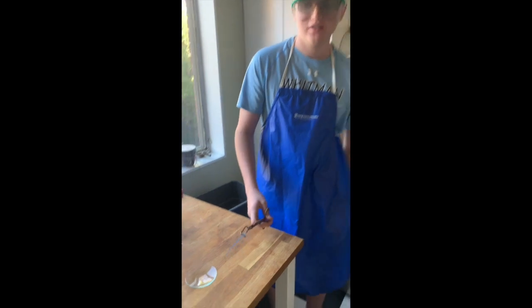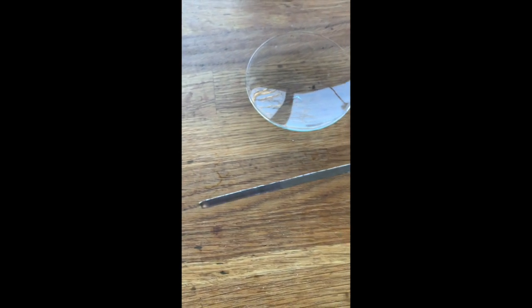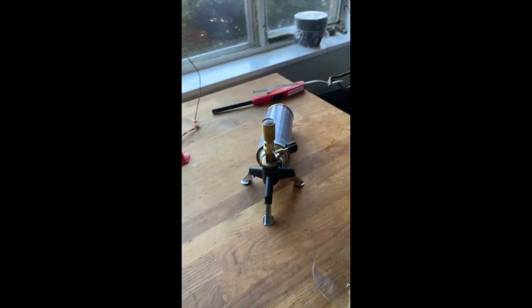Station 7. This is the magnesium. Magnesium is a silver colored metal. We're going to react this with oxygen by burning it in the Bunsen burner. You guys are fine watching this on the video. I have told Maurice that he should not look directly at it as it reacts.